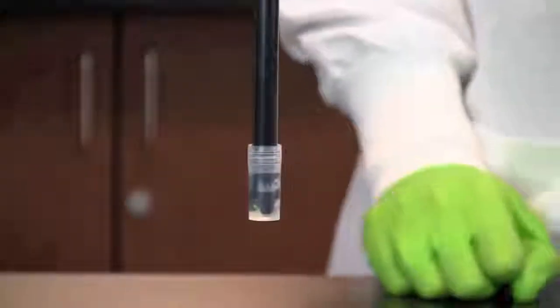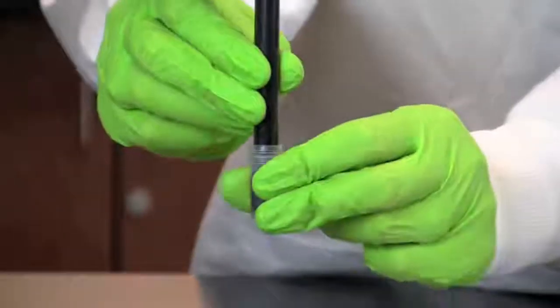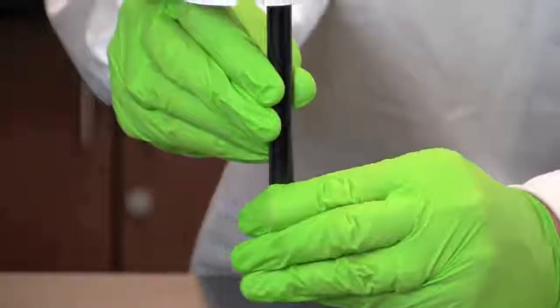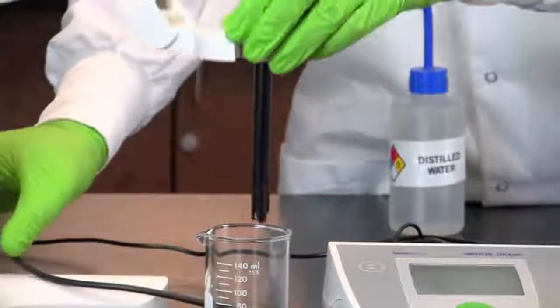The first step in using a pH meter is to remove the protective cap from the electrode. The electrodes of the pH meter need to be stored properly, capped, and immersed in a storage solution to prevent them from drying out.